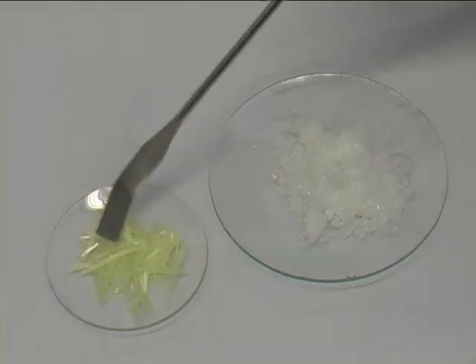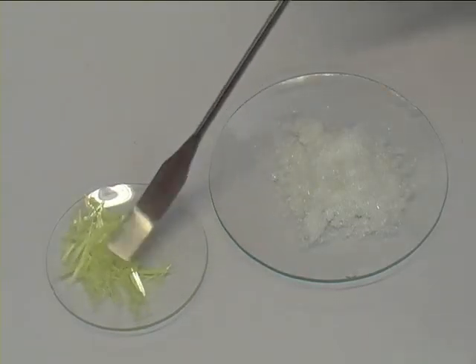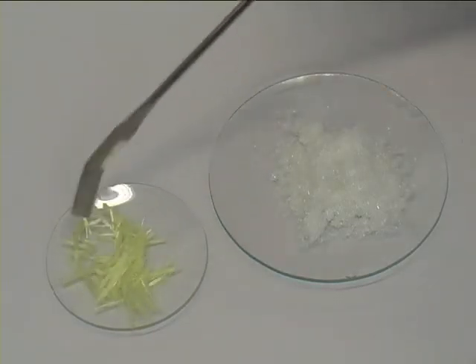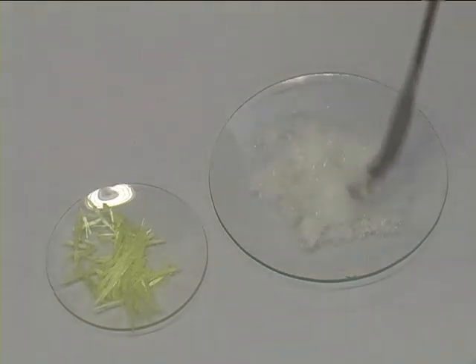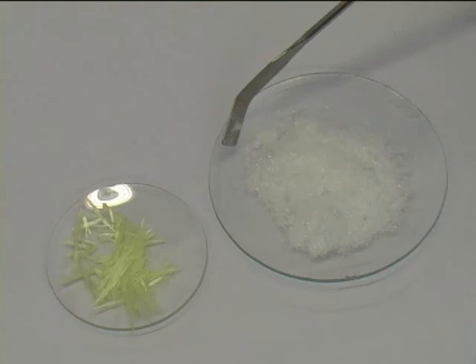You can also see a clear difference. When it is crystallizing very slowly, you end up with nice crystals. When you crystallize it fast with a rod and some cooling, you end up with small crystals that are less nice.